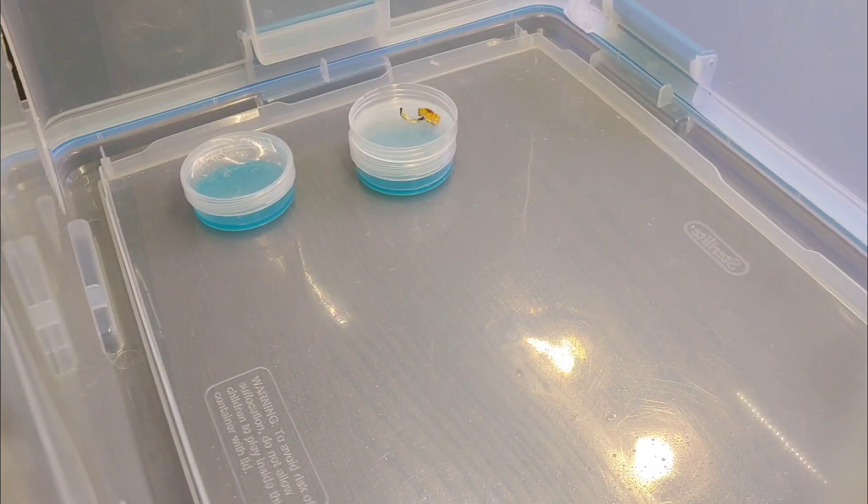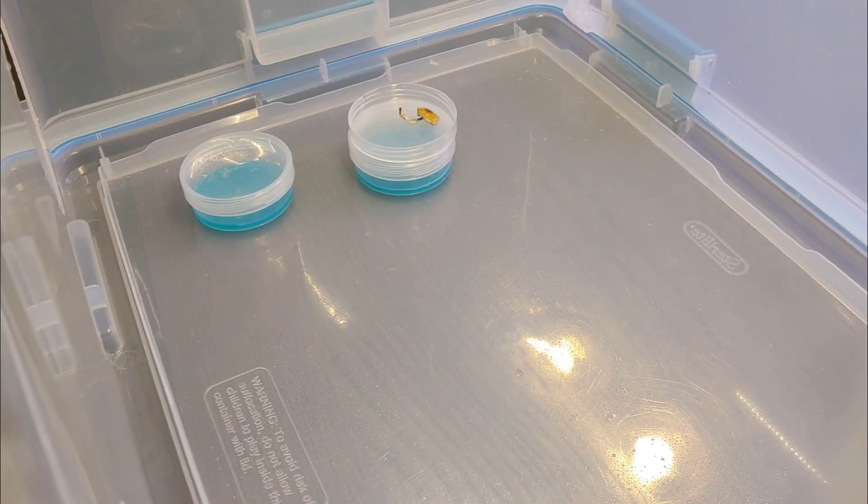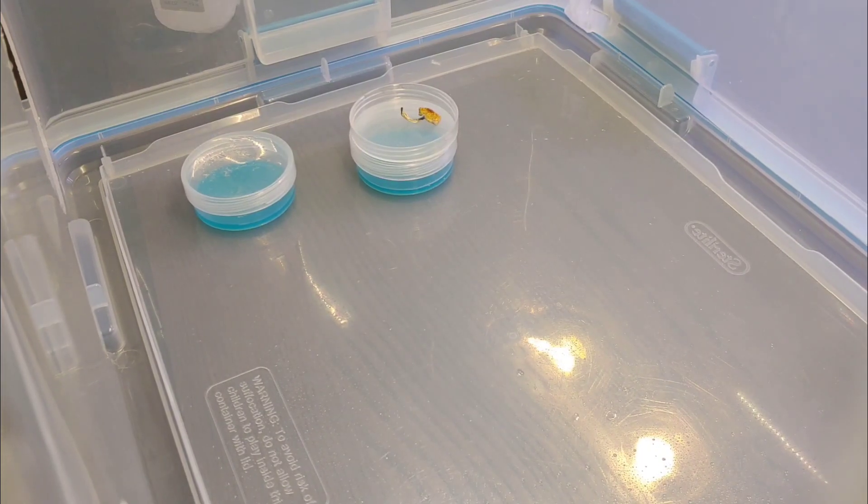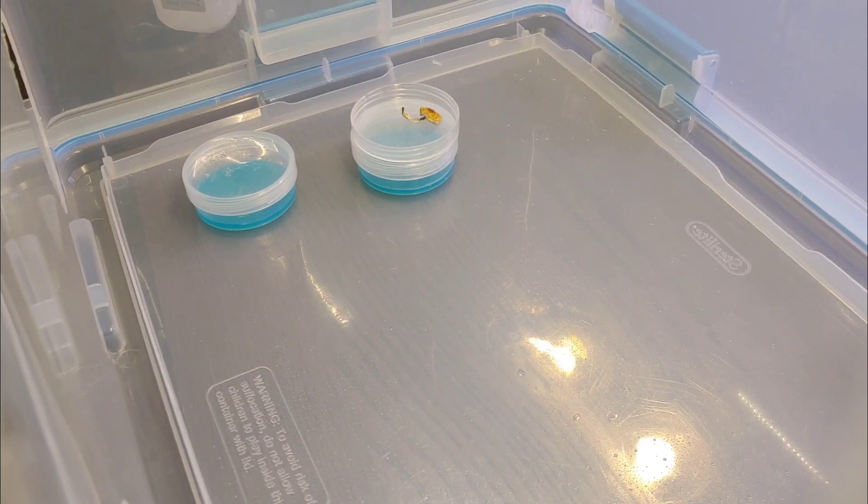All right, we are going to try an experiment here. I have heard that you can clone mushroom tissue from dried mushrooms.